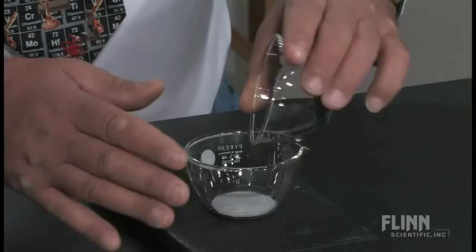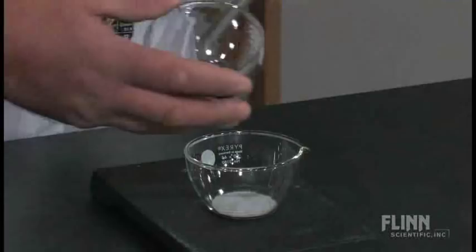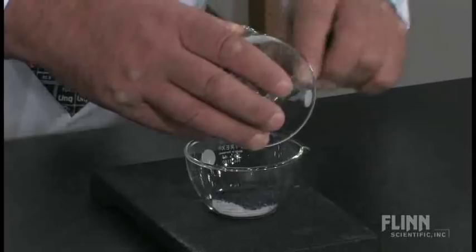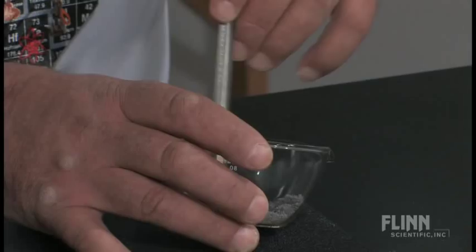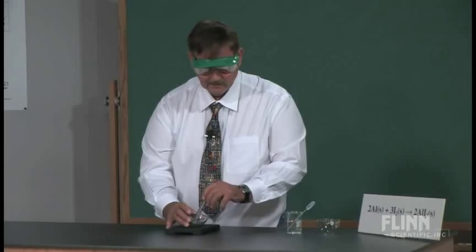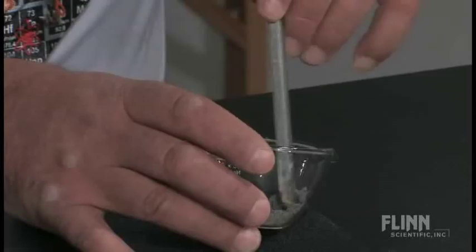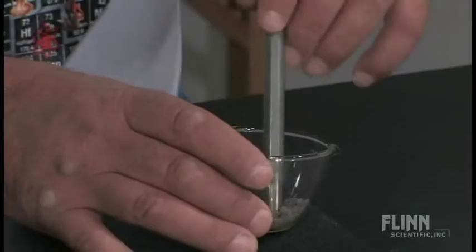What I'm going to do is I have the aluminum here, and I have the iodine, and so I'm just going to pour them together. Once I have them together, I'm going to mix them. And again, they say be careful when you're mixing oxidizers and so forth. Well, this is pretty good. This is not one that I've ever had any kind of problems with, other than if it's real high humidity. I can already start to see some purple vapors in here.